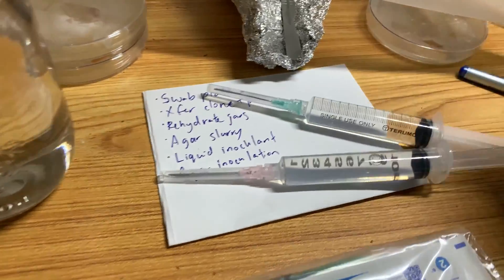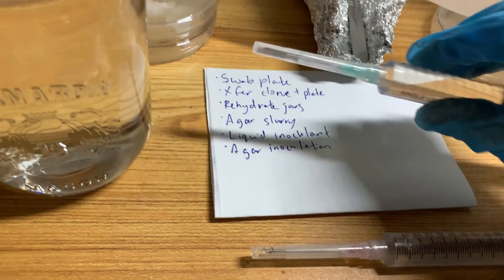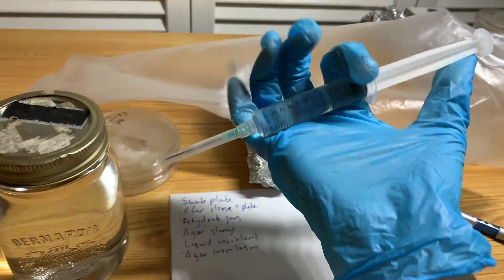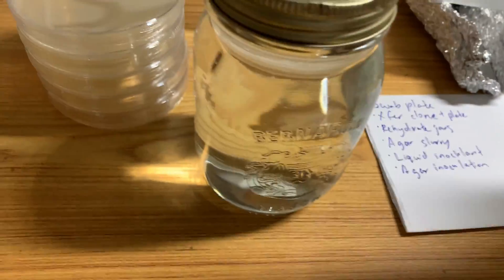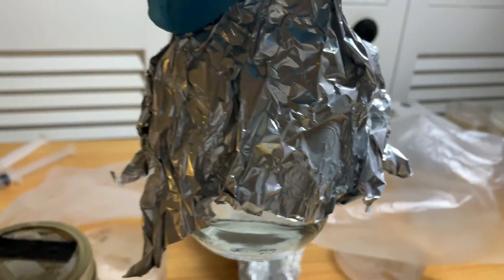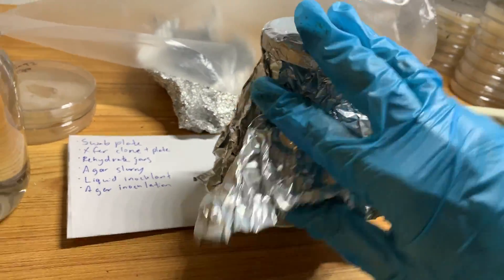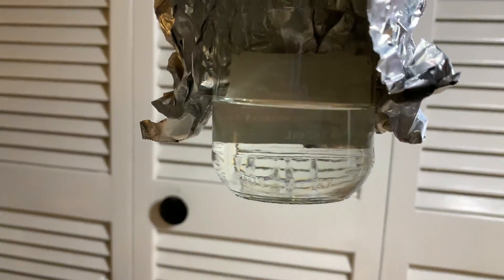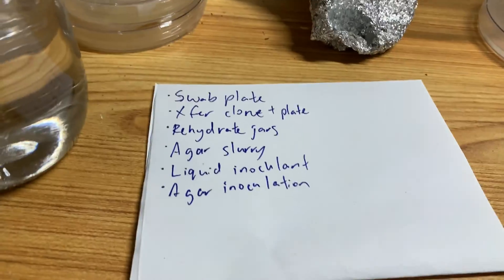I've got two syringes: one I'm going to use for agar slurry, which has a slightly bigger needle tip — that's why I use it for agar slurry. The other is a little smaller, so it's good for spore syringes and also for rehydrating jars. All this water is sterile. I'll do the first jar with one syringe, then pull water from the rehydration jar and shoot it into the grain jars I want to rehydrate. And then I have this one for the liquid inoculant — it has less water than the others, which is perfect. This will be enough for three jars, and it's a smaller mouth jar so it's easier to pour.